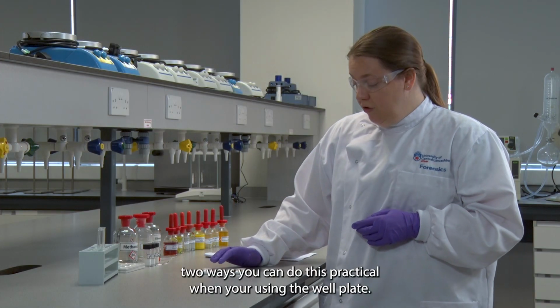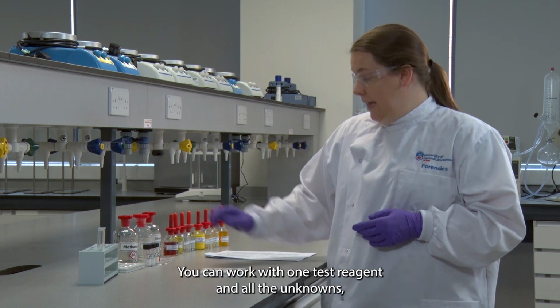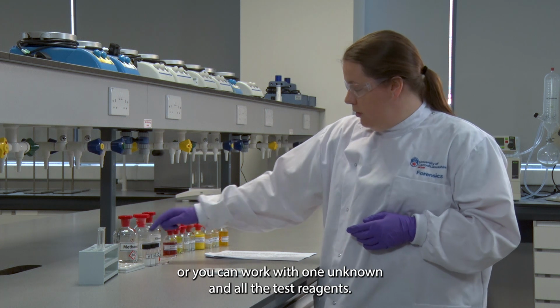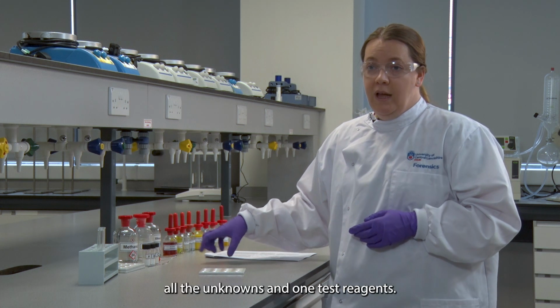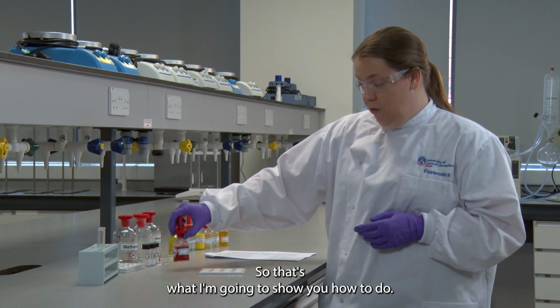So there are two ways you can do this practical when you're using the well plate. You can work with one test reagent and all the unknowns, or you can work with one unknown and all the test reagents. The way that I found most efficient is to use all the unknowns and one test reagent. So that's what I'm going to show you how to do.